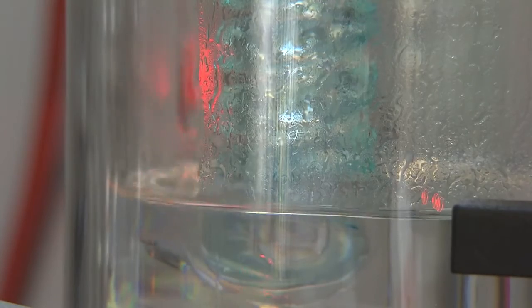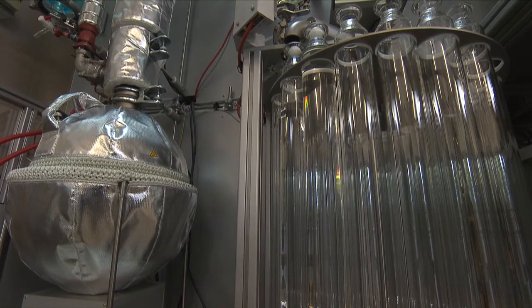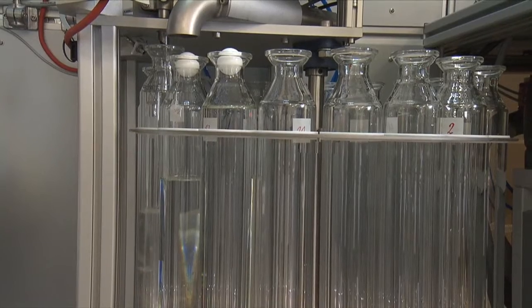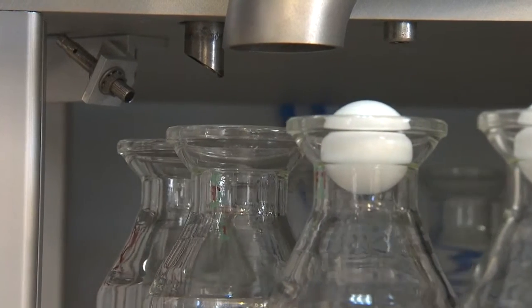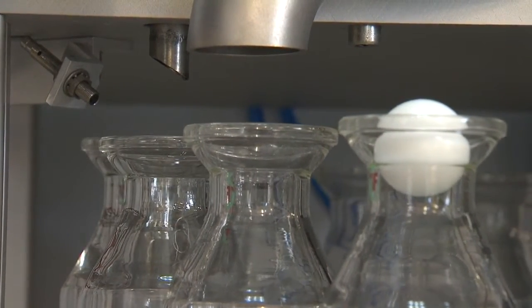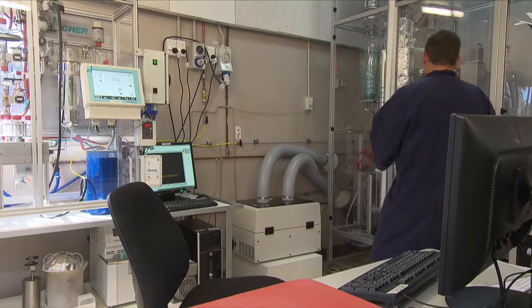It will continue collecting defined cuts at atmospheric pressure up to a temperature of 200 degrees Celsius. After this it will switch to a vacuum mode, continuing the distillation and collection of cuts at a series of different vacuum pressures ranging from 100 torr to 0.1 torr. For each cut, mass and density data is obtained and this data is used to calculate the yields of each different cut.